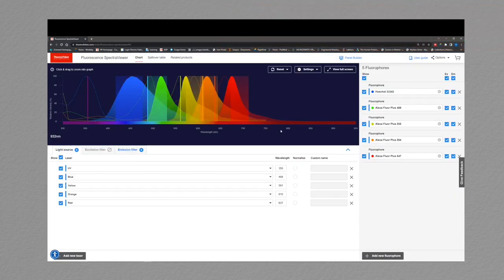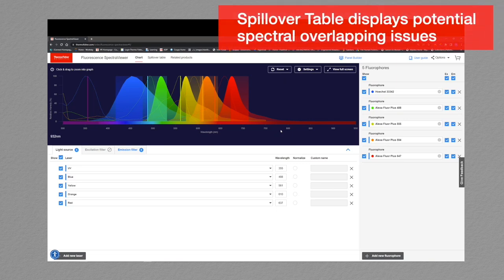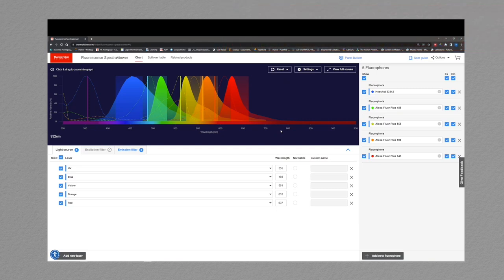In part 1 of this tutorial, I showed you how to set up your instrument parameters and add fluorophores to fill out a 5-color panel. Additionally, I included a couple of fluorophores that have some spectral overlap. In this part, we will introduce the spillover table function and how it is used in designing multicolor imaging experiments. When you're using multiple fluorophores within one experiment, it is important to understand the percent fluorophore emission spillover into another channel. There are 2 ways to get into the spillover tables.